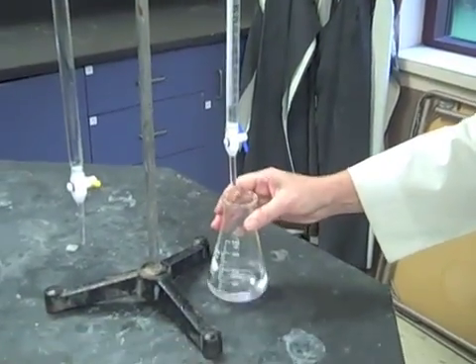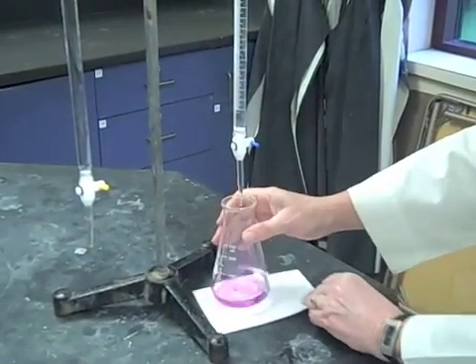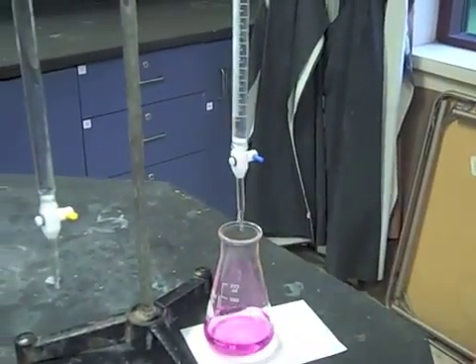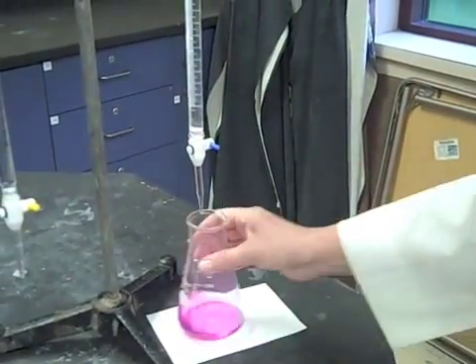So, I'm doing it in a drip-wise manner. And I'm going to put this white card underneath this because I don't want to overshoot. And it even looks like on the first titration, I may have overshot it.